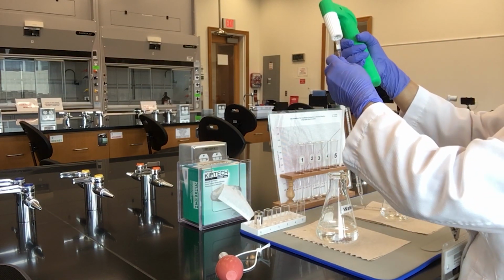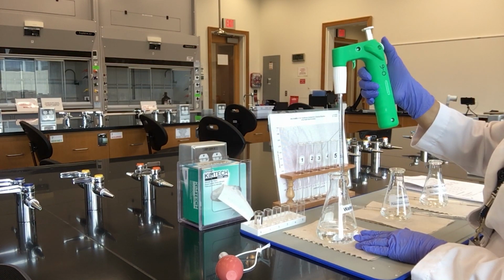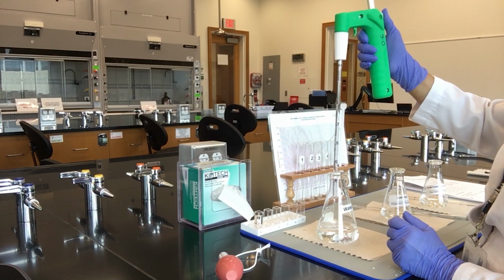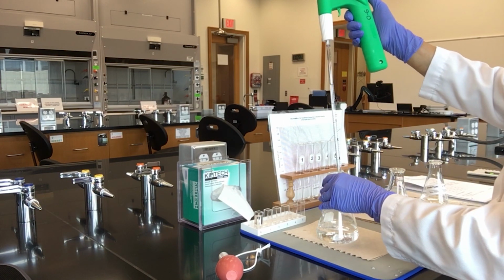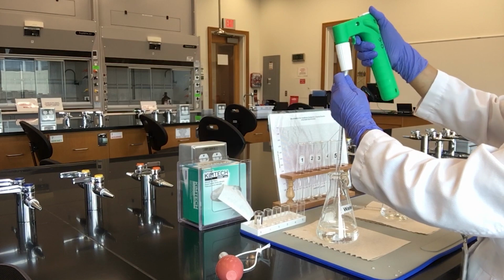Now it's time to learn how to use the pipette pump. Insert the pipette into the pump. Gently rotate the wheel of the pump clockwise to aspirate the liquid until you get to the desired volume. Remember to measure the volume of the liquid at eye level, and measurement should be at the lower meniscus. To dispense the liquid, rotate the wheel counterclockwise. Now you're ready to start your experiment.